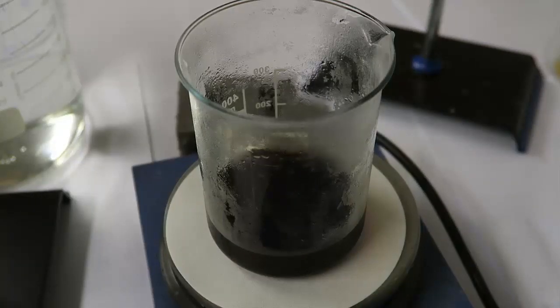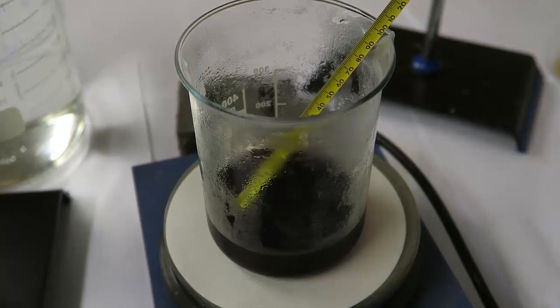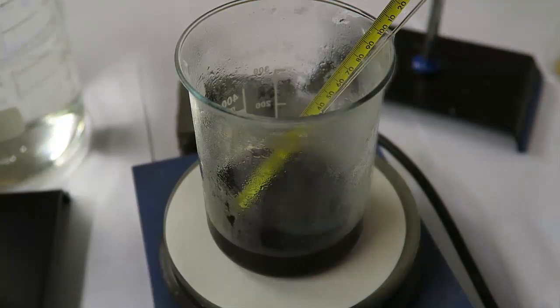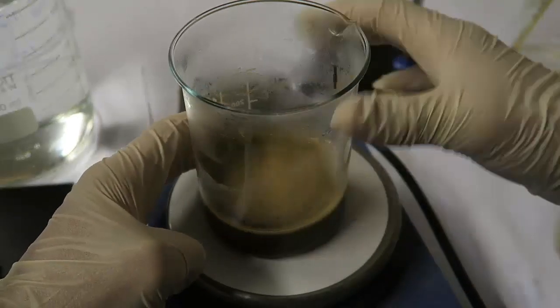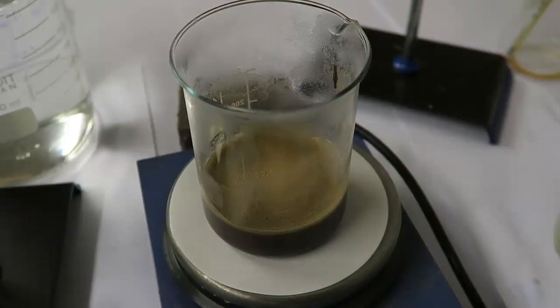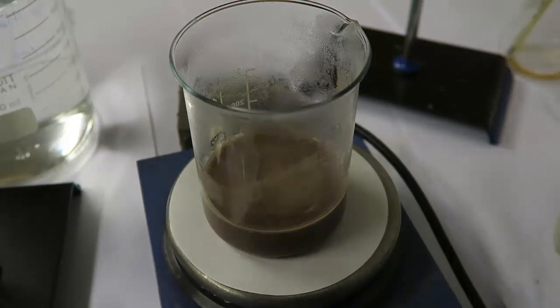Next, the liquid will be cooled and transferred to a beaker. Slowly, 17.3 mL of concentrated HCl are added. This will neutralize any remaining sodium hydroxide. Then 8.1 mL of glacial acetic acid are added. This will precipitate the anthranilic acid. Acetic acid is used because strong acids like hydrochloric or sulfuric acid would protonate the amino group. This would form a soluble salt.